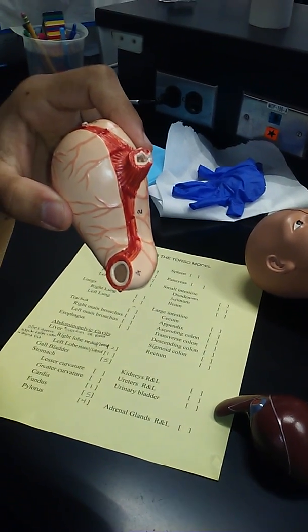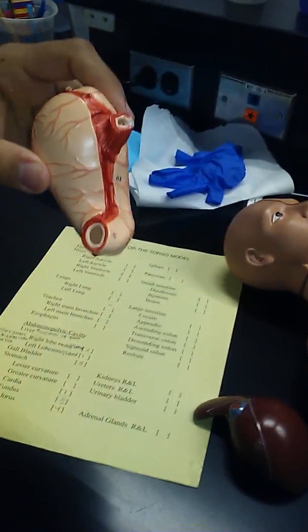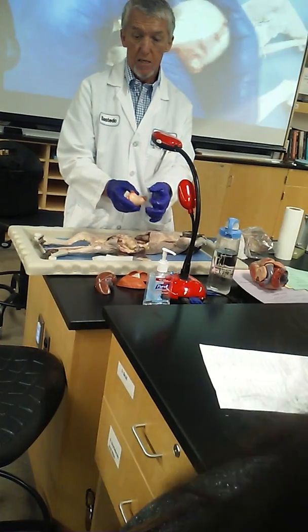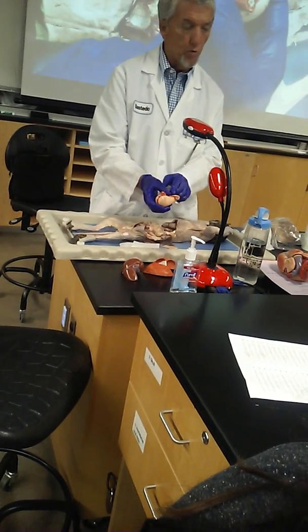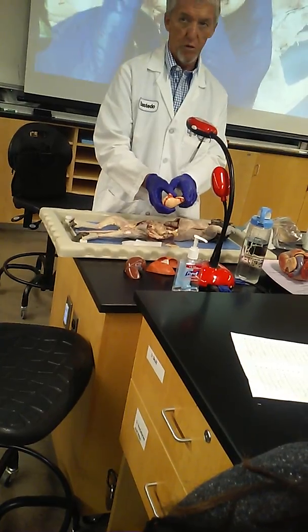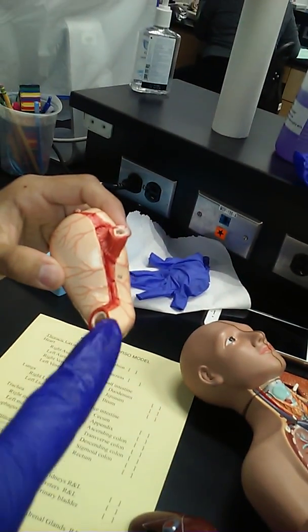Not the planet, your anus, right? There's an anus-like muscle right here, very tight, that squeezes and keeps the food in the stomach until it's thoroughly liquefied. No chunks should get through here, just liquid food. So right here where the number 4 is really the pyloric sphincter valve as well.